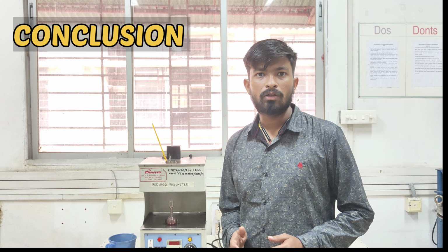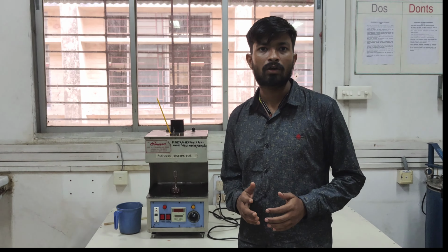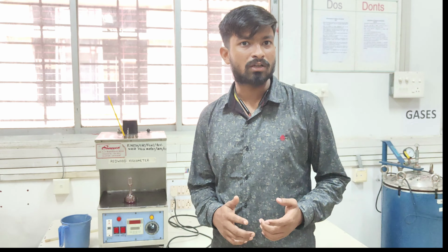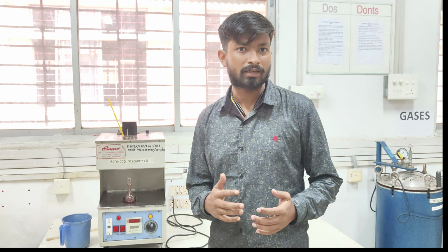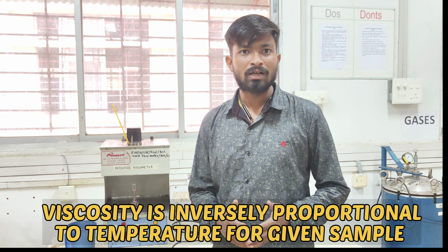Now I am going to tell you about the conclusion of this experiment. First, we concluded that as we increase the temperature, the viscosity decreases, meaning that viscosity in the Redwood viscometer is inversely proportional to the temperature.